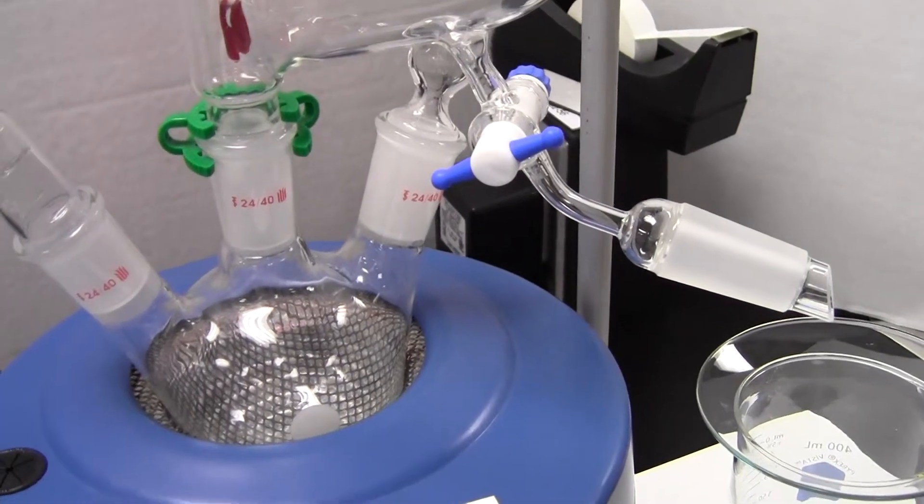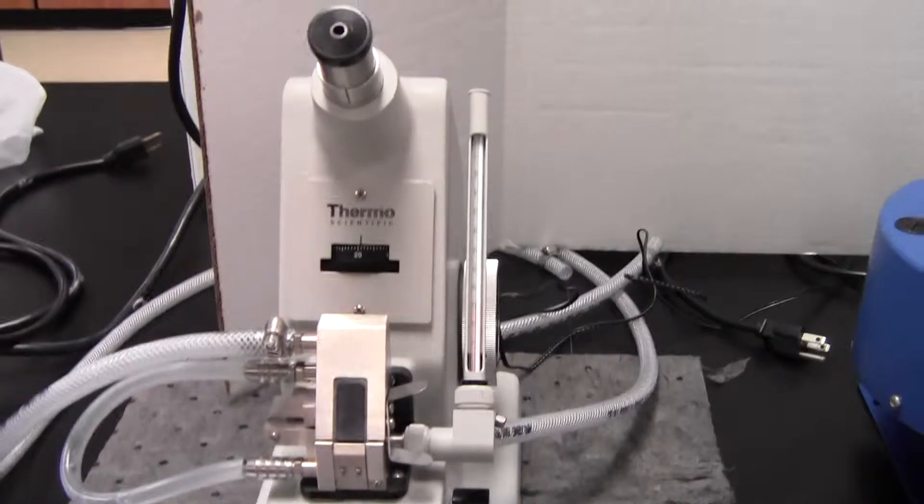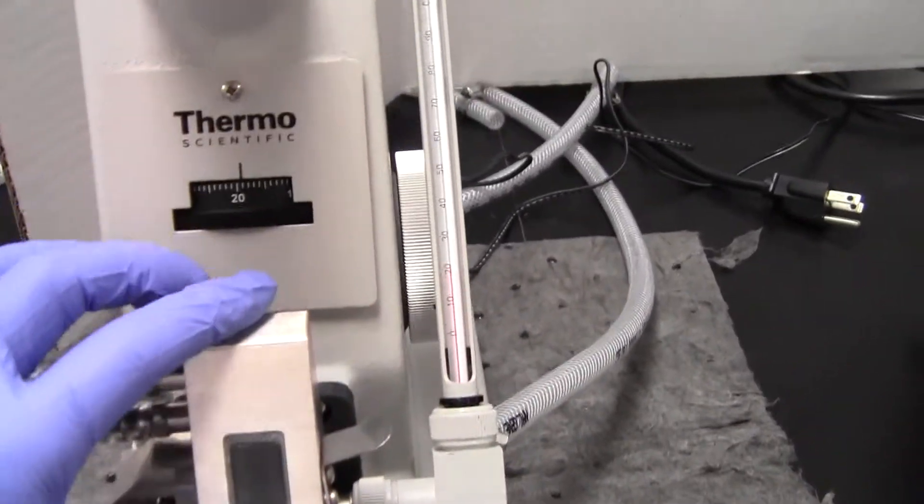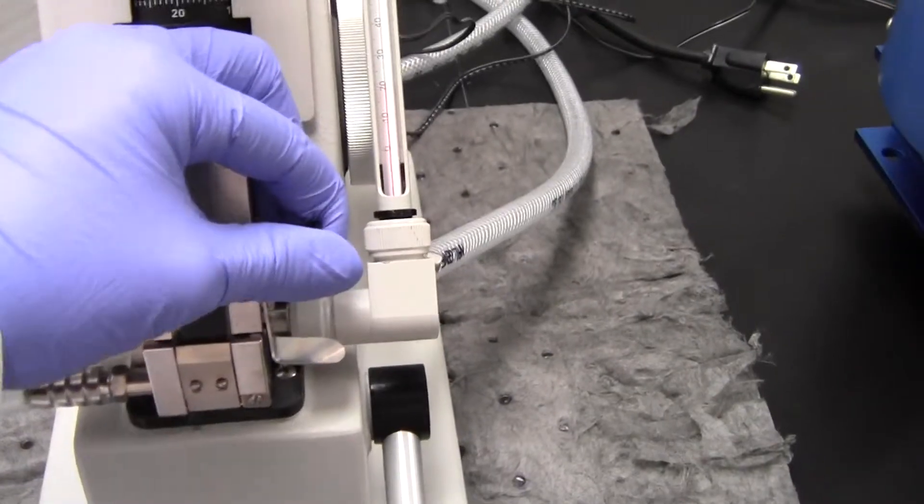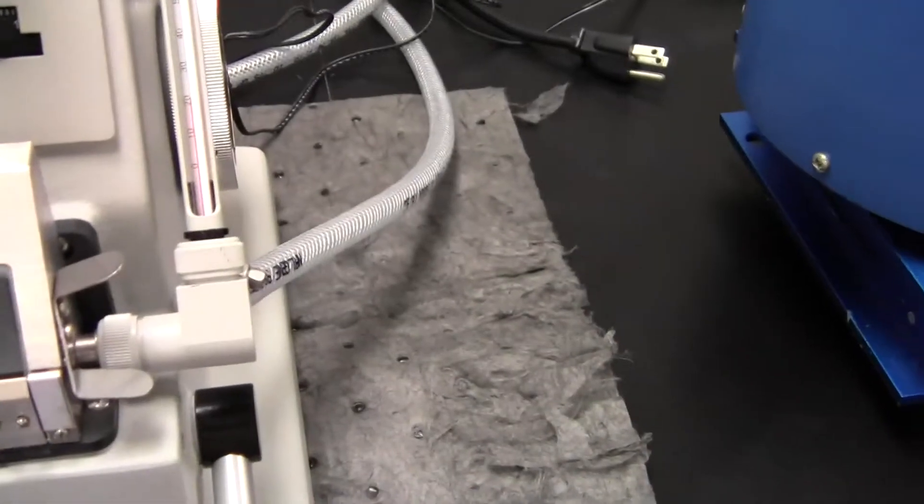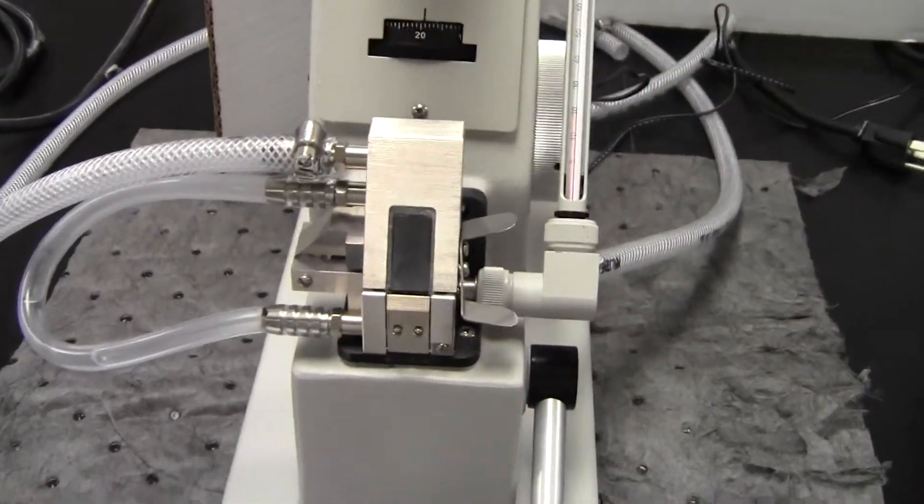We didn't measure the volume too precisely, so how do we know the composition? We're actually going to measure the refractive index using this refractometer. There is a prism here which is sliced so you can put your liquid in the middle of that prism and shine light through it.